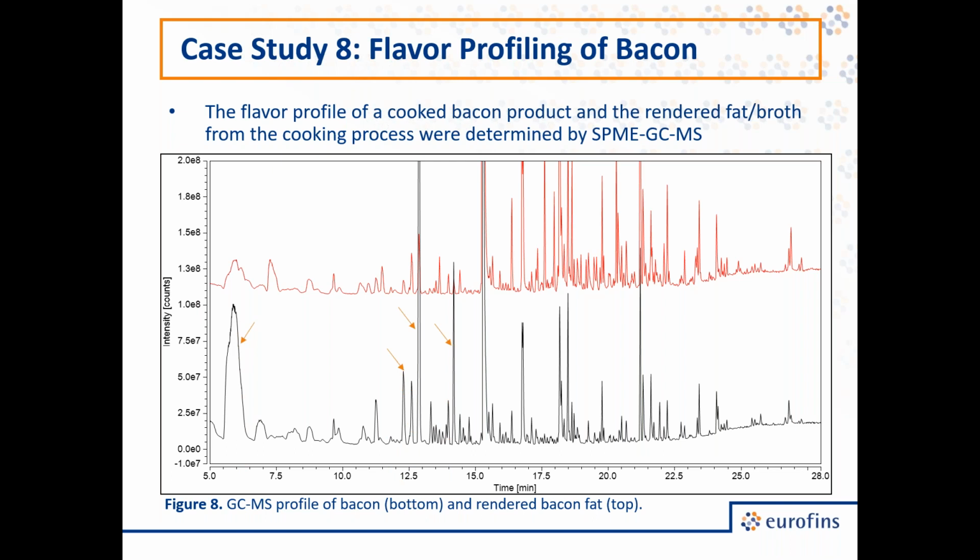These orange arrows are pointing at compounds that are known to incorporate sweet odors or flavors. As with the orange arrows, we're seeing primarily these compounds being more abundant in our bacon. And then blue arrows here are pointing at fatty or acidic flavors. We're seeing more abundance of these in our rendered fat broth product. And the final thing I'm highlighting here with green arrows, these are compounds that contribute roasted or caramel-like flavors and odors. And once again, we're seeing more of these in our bacon than in our broth.